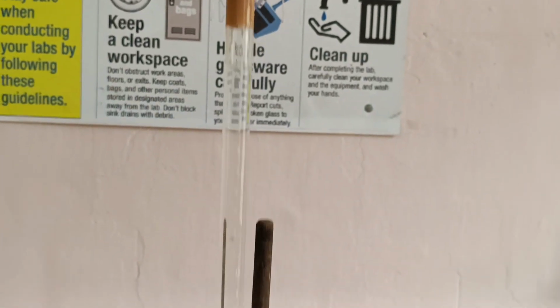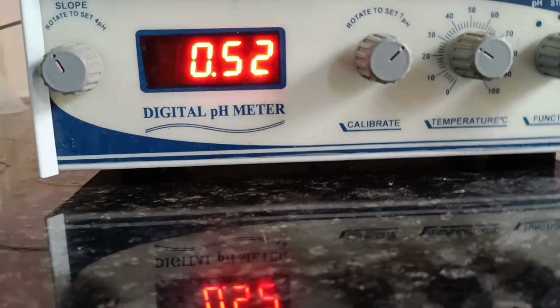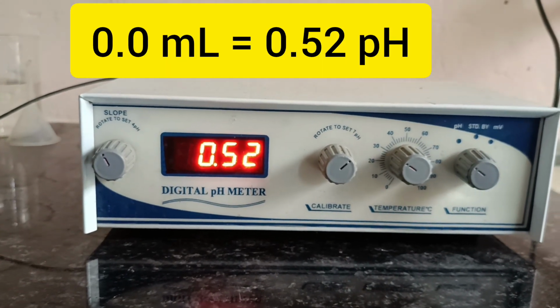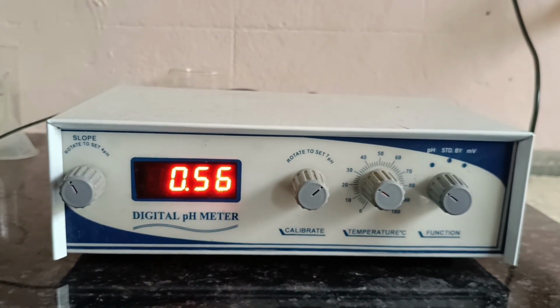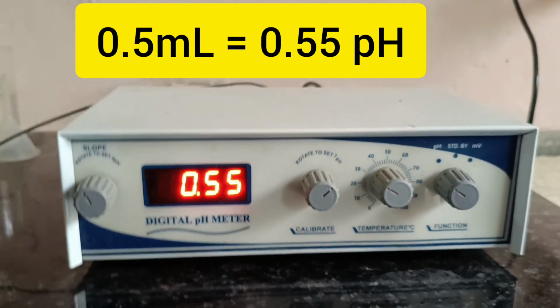Now the pH meter instrument shows the reading before adding any of the NaOH solution from the burette to the HCl, that is 0 ml reading. It shows 0.52 pH. Now again 0.5 ml of NaOH is added from the burette and the pH meter shows the reading of 0.55 pH.